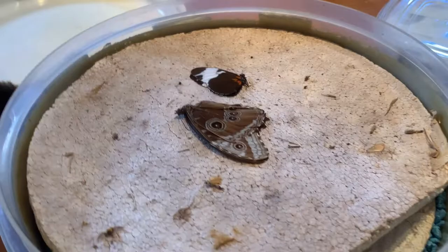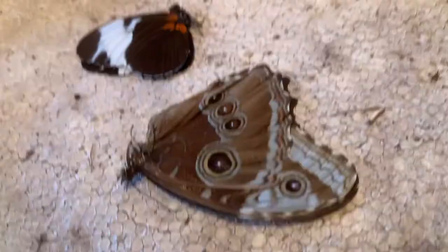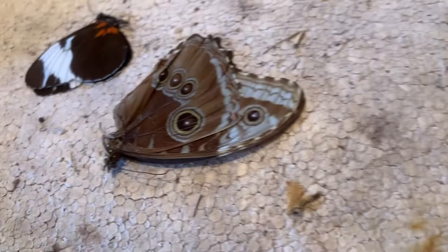Especially these specimens were very dry — they have no natural body fluids whatsoever and they are super, super crispy. So you don't want to try and flex your butterfly wings until it is time.